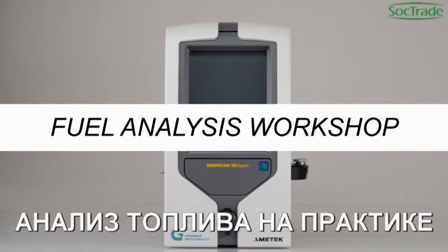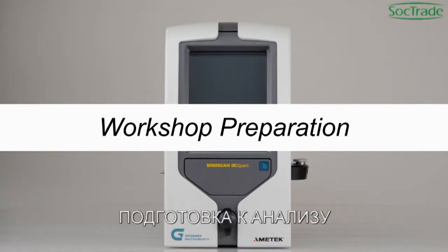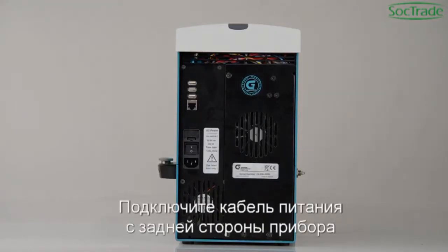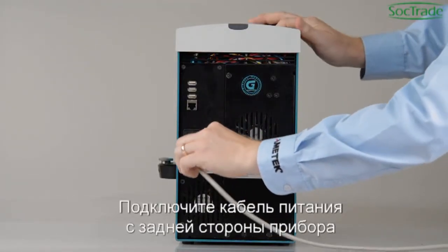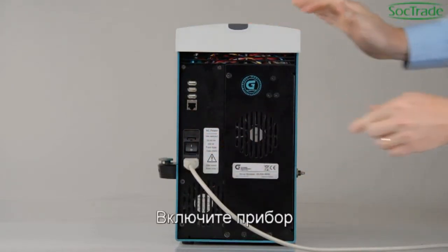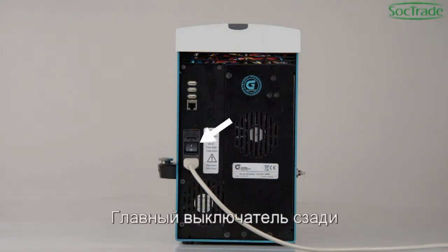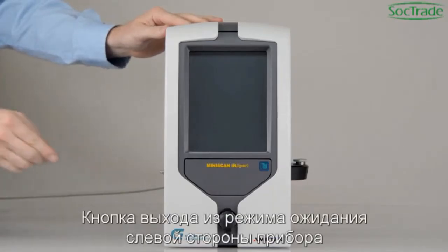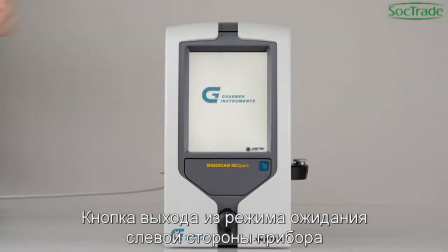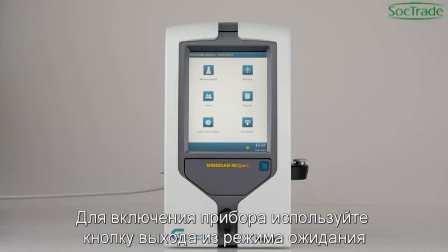Fuel Analysis Workshop — Workshop Preparation. Connect the power cable to the rear side of the instrument. Turn on the analyzer. There is a main switch at the back and a standby switch at the left side of the unit. For turning on the instrument, use the standby switch.